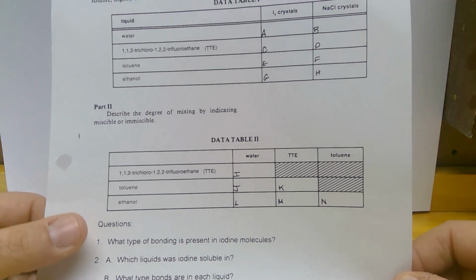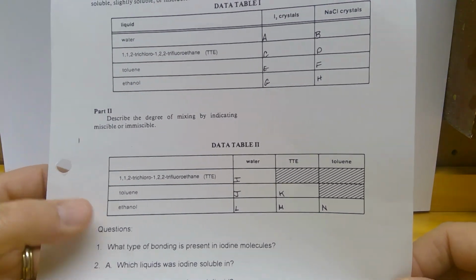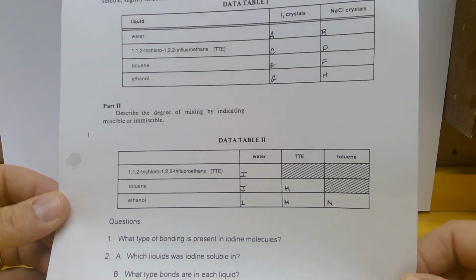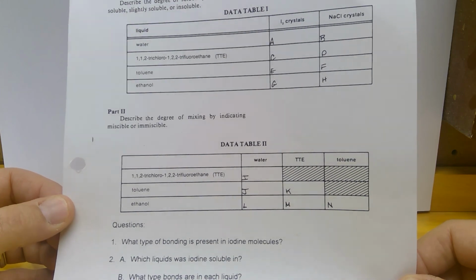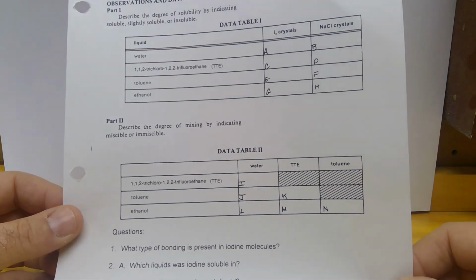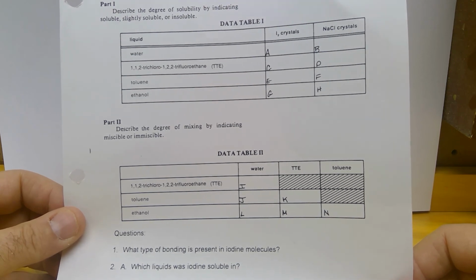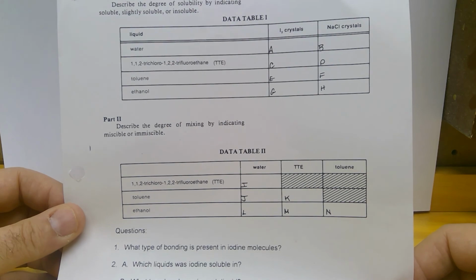Now there's one of these, if you look really carefully, that's an issue. You should understand what I mean when you figure out which one I'm talking about. I'll give you a hint. There are some substances that can act both as polar and non-polar substances. So that's your hint.